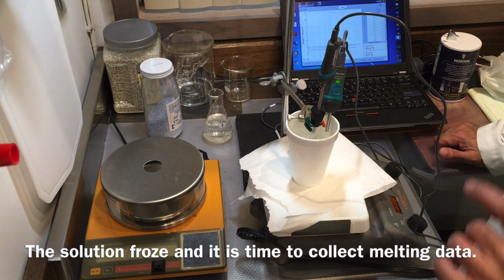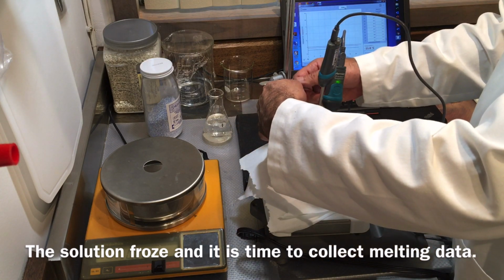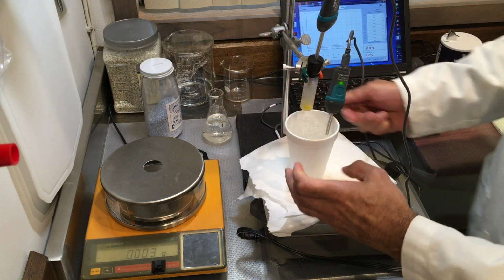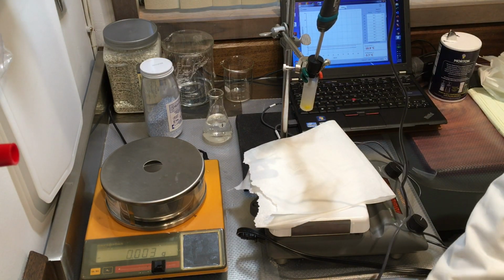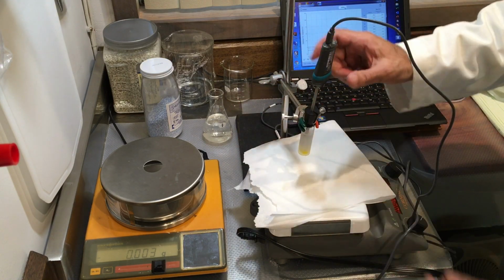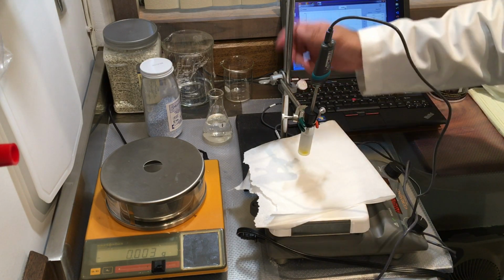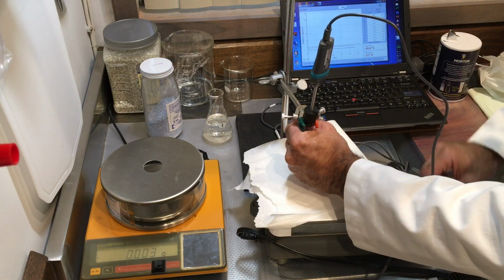Okay, now I want to melt this and show you what happens again. So let's go ahead and remove this. You can actually see what's happened here. I'll put my ice water mixture here. See, this is frozen very solidly. Even the stirrer cannot move. So let me go ahead and melt this.